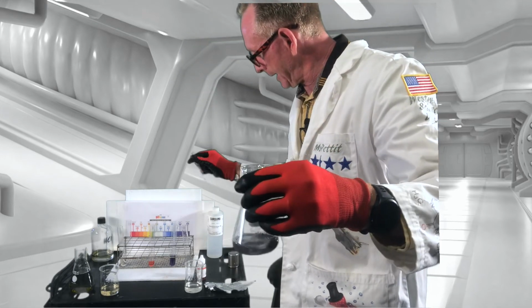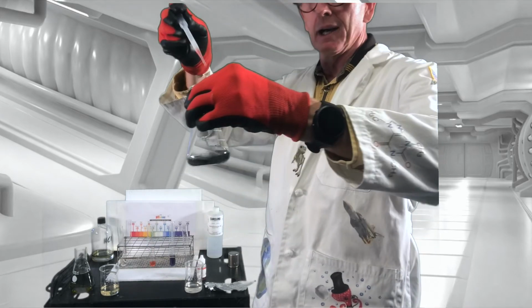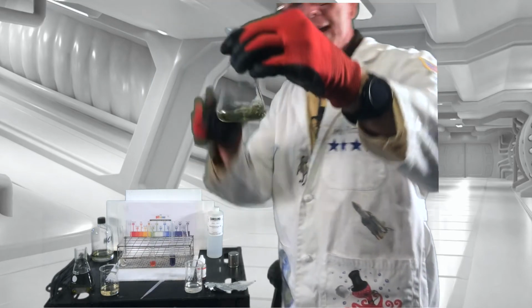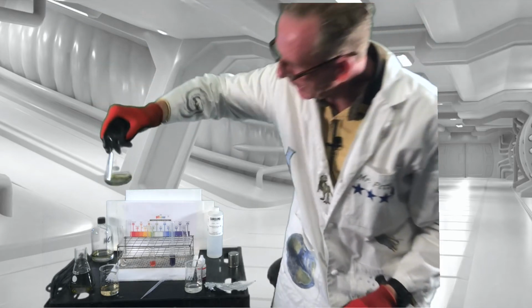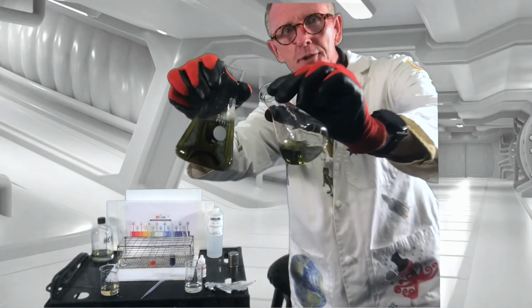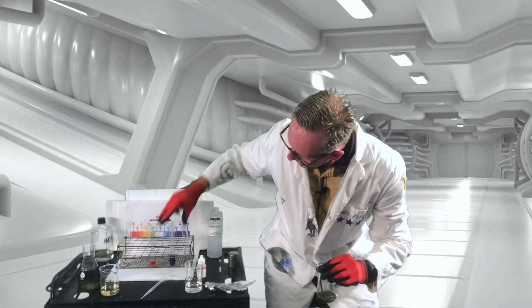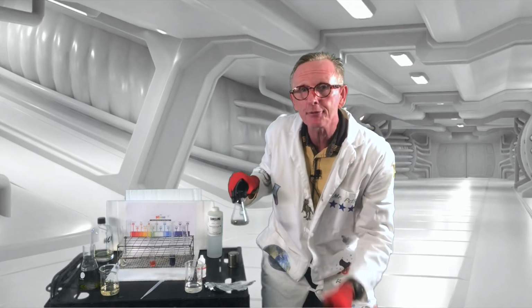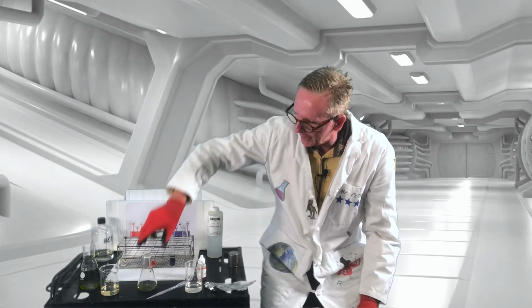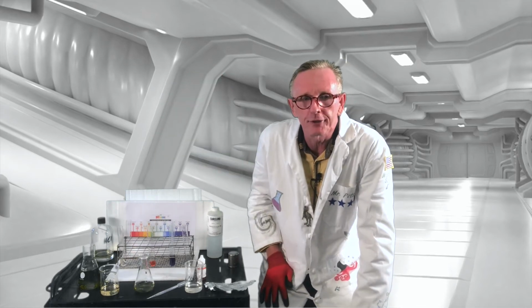So if we take them and mix one with the other, eventually we can take a strong acid and a strong base as another way of comparison and get back to a neutral. Now, it wasn't exactly, if you notice, half and half. If they had been exactly the same, we could have just dumped them in together. But in order to get it back to a neutral, took a little more nuance, I would say.